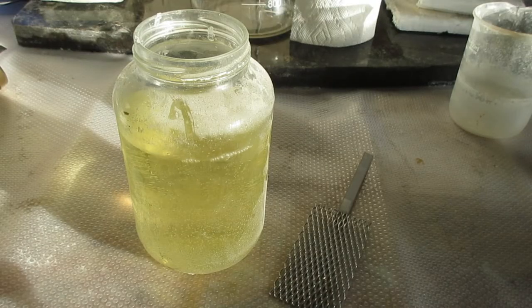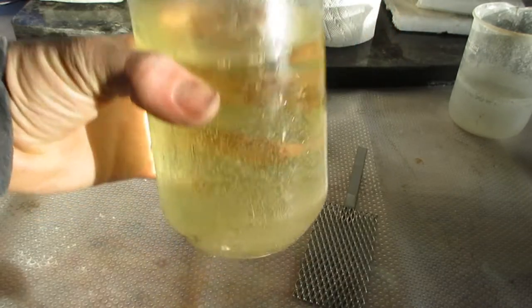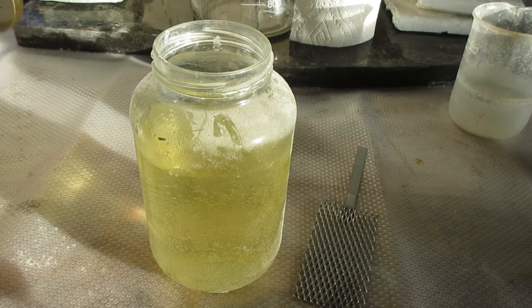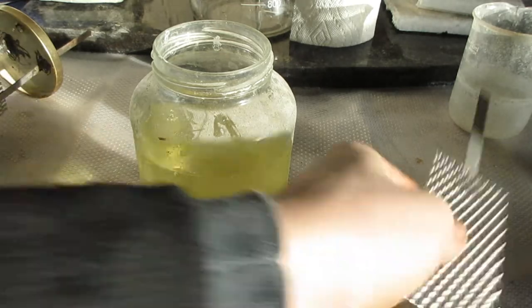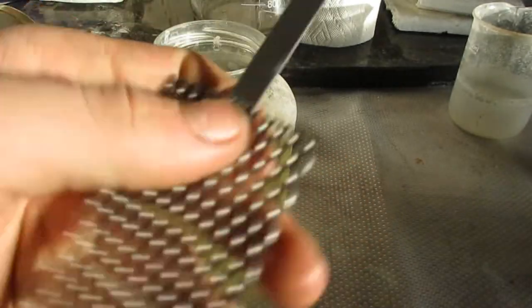Now, of course, just to be sure, I also ran this thing in a saltwater electrolysis solution for a few minutes, and the solution turned totally yellow. That is not supposed to happen. If you do that with any other anode that can handle that, then that will not happen. So it is obviously corroding. It looks like from this weld here, but given enough time, I'd imagine that the whole thing would just turn to dust.